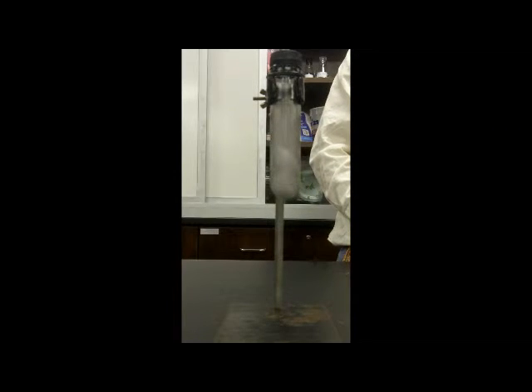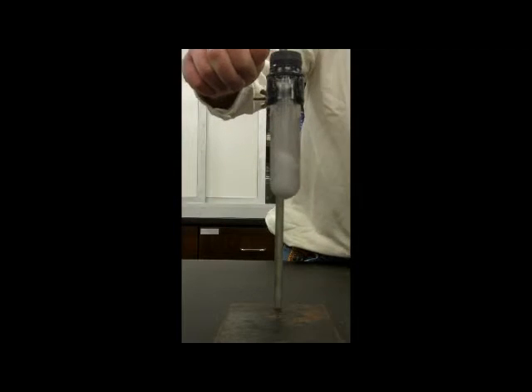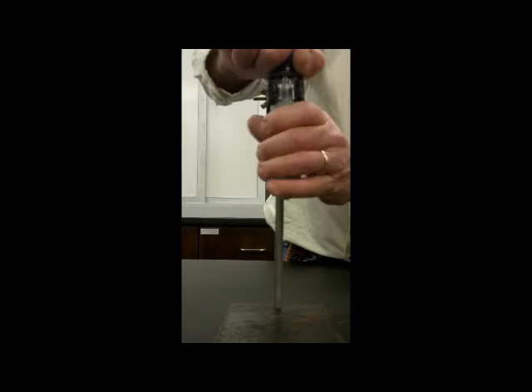It's going into a liquid. Now it'll go all the way into a liquid. I don't know that I want to wait for it to go all the way into a liquid. Well, maybe I'll give it a little more time. And the pressure is getting quite high, right? Now, of course, if the pressure gets released, it's below its triple point, it can no longer form a liquid. It's only a solid and a gas. So at some point, yeah, maybe now, I'll give that a try. Let's see if we can do that.